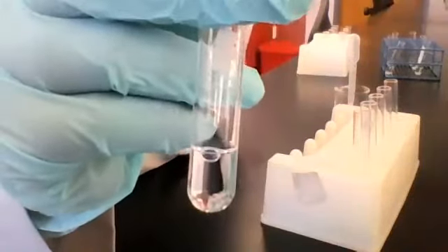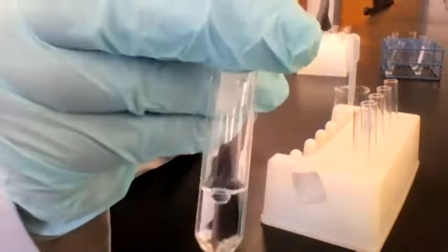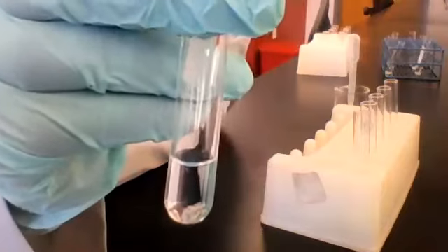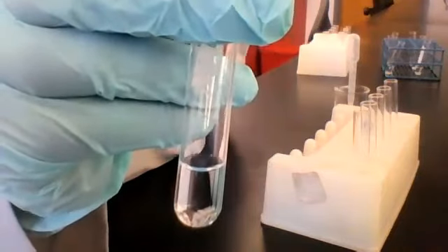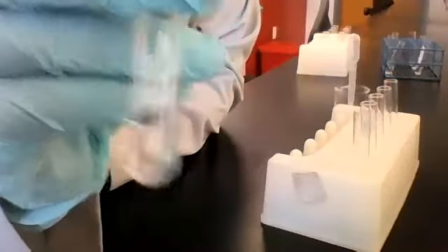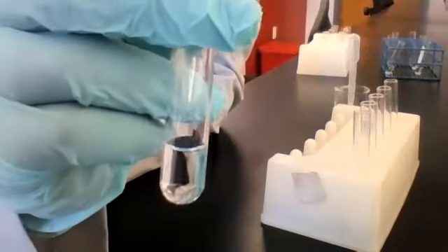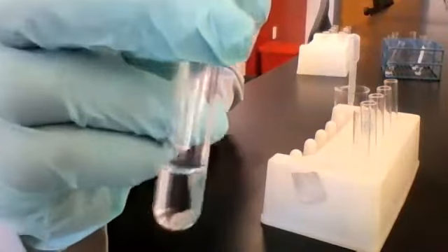And just like before, is there a common ion between NaCl and HCl? The chloride. So even if these two compounds exchange ions, we're going to end up, like I said before, with the same combinations, right? So no new compounds have formed.